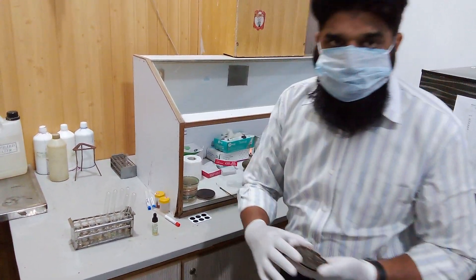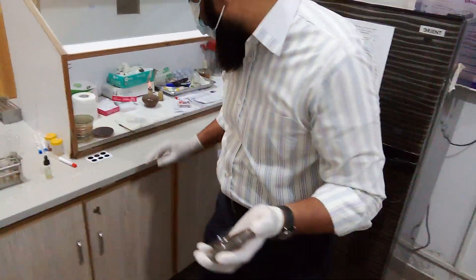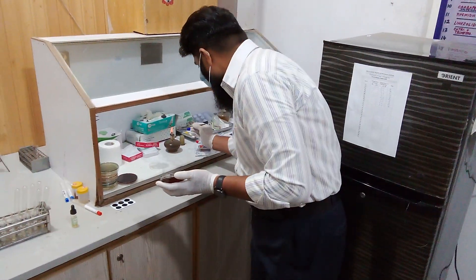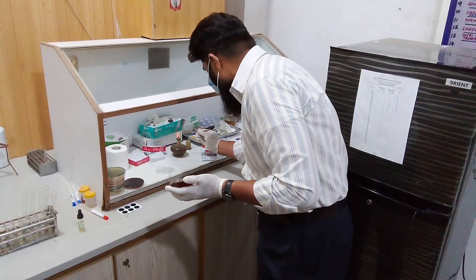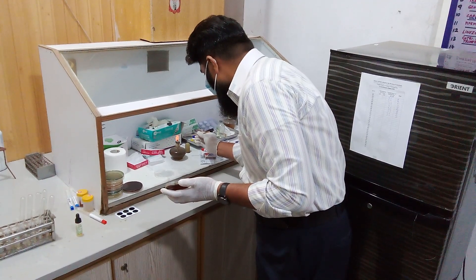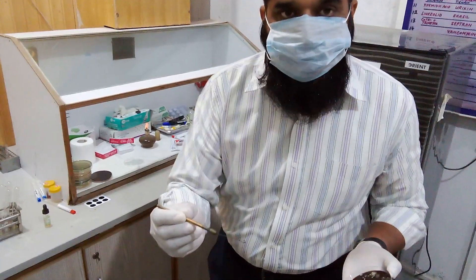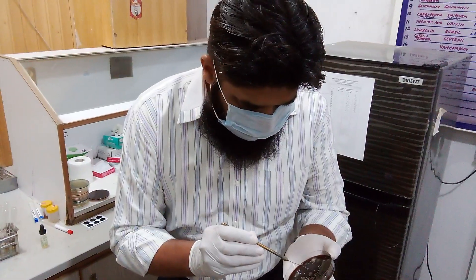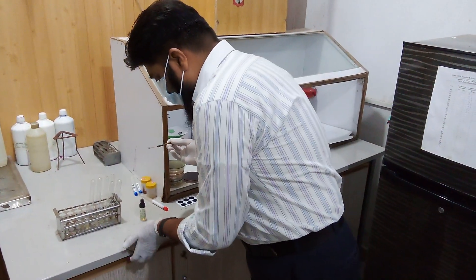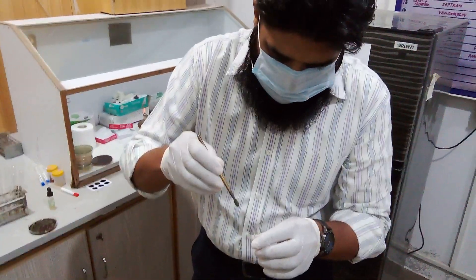This is an old gram-positive growth — unknown growth. Now first we will sterilize the wire loop on the Bunsen burner. As the wire loop is red hot, we will pick up a gram-positive colony and place this gram-positive colony into this solution.